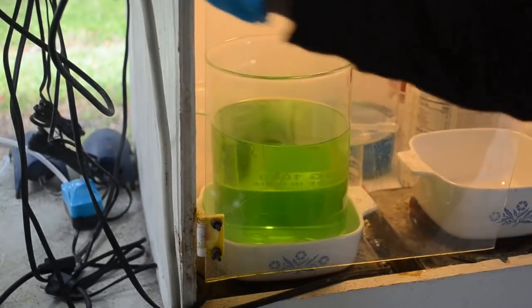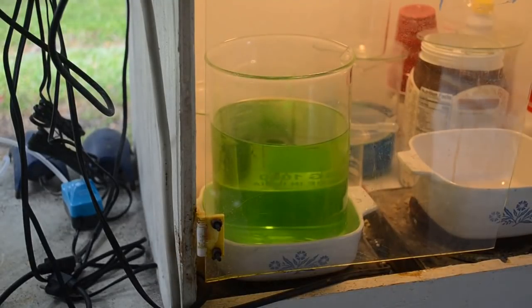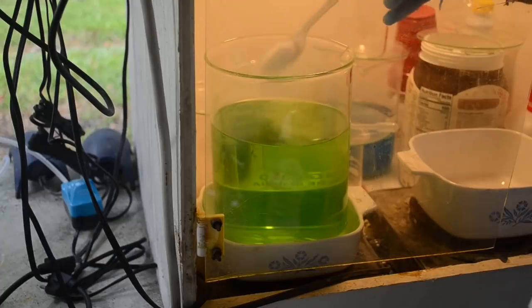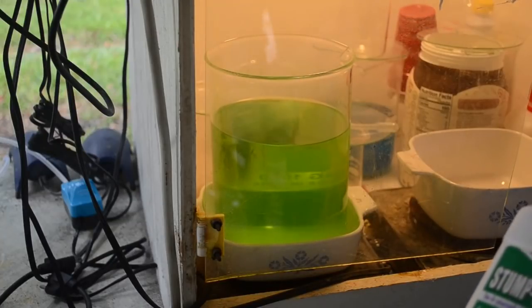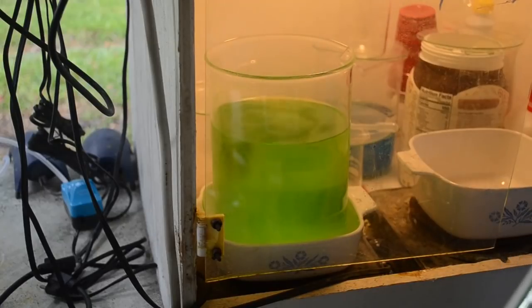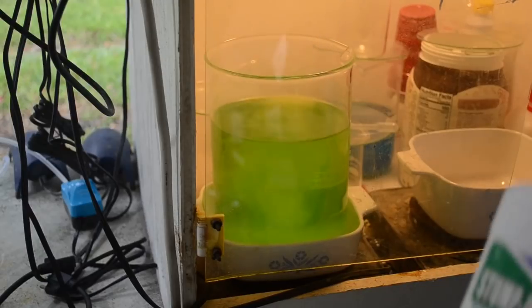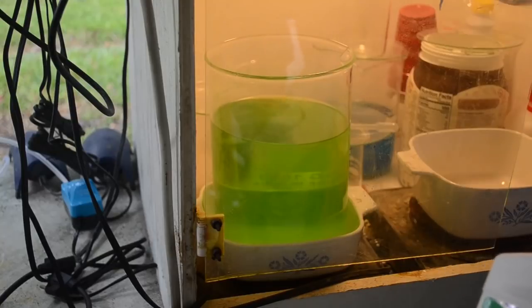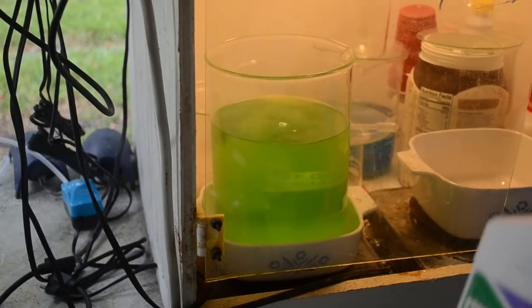Alright, all the liquid's back in the big beaker. Let me get the fume hood going, and we'll see if we can drop this gold. Got a Stump-Out here, but it's gone lumpy on me, even though I keep it in a plastic bag. Big lump in here. It took a fair amount last time to get the gold to drop, so put that in here again. I don't know if I want to throw this big lump in or not. I need to break that up. One more. Whoops. Partial spoonful.